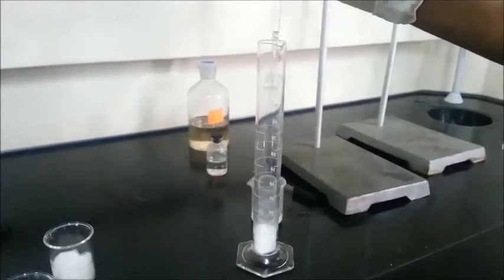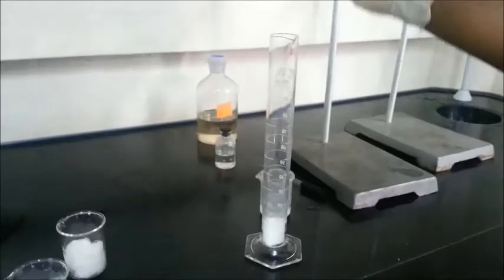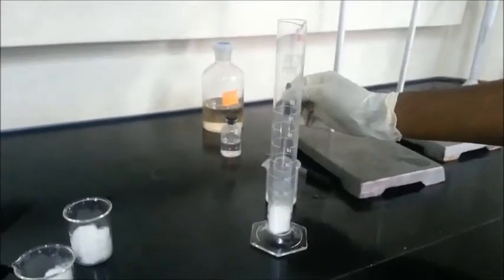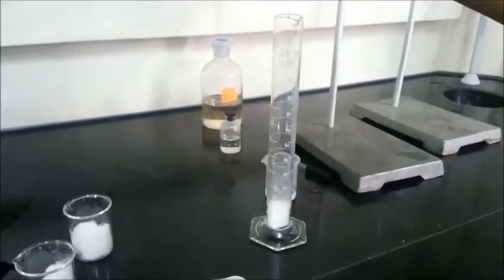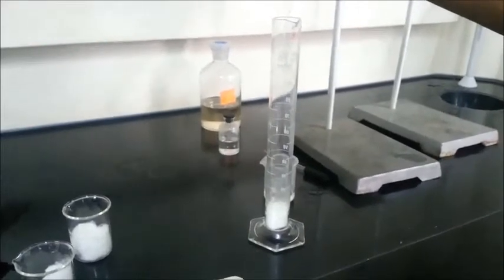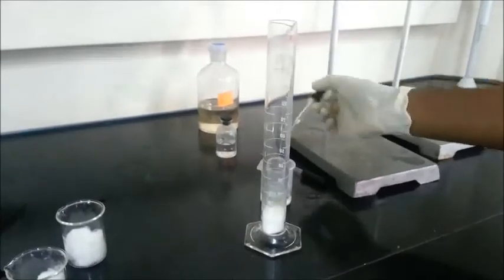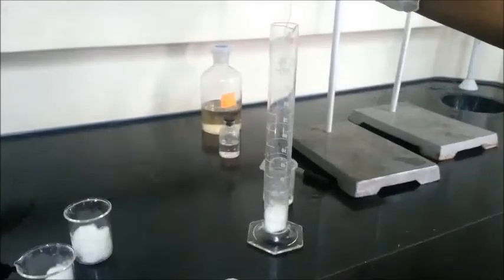As we can see, place a piece of cotton wool at the tube and push it into the end of the tube, and then drop a concentration of ammonia solution on the piece of cotton wool at the end of the tube. Ammonia and hydrochloric acid are colorless gases, but when they meet, a white cloud from ammonia and hydrochloric acid will form.